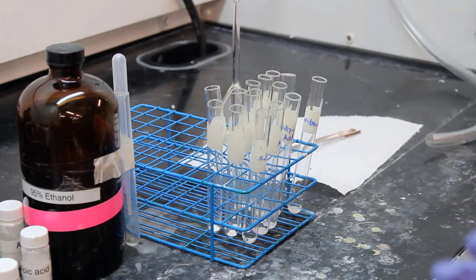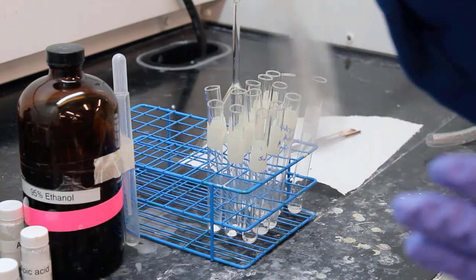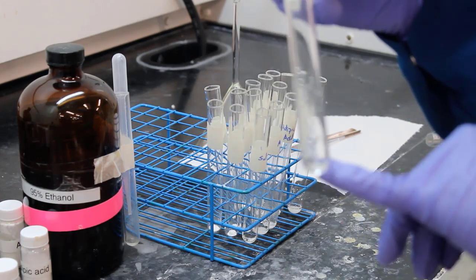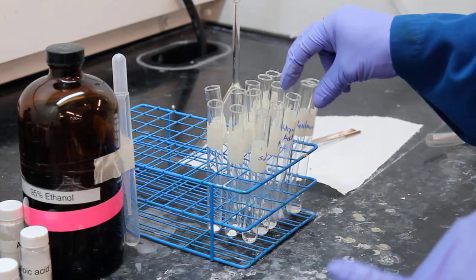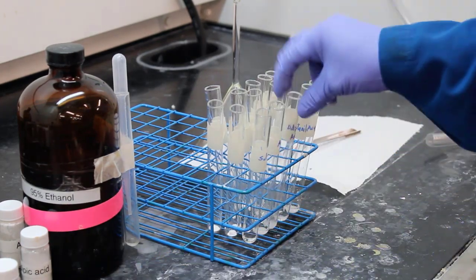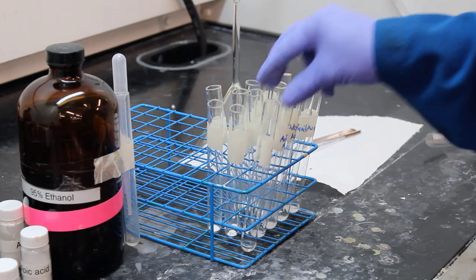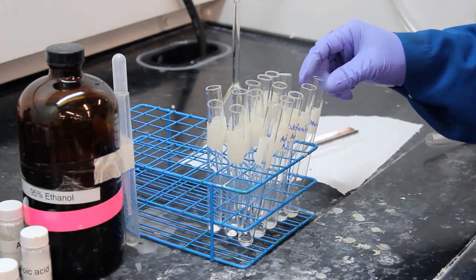All right, they're going to be persistent here. There we go. Let's check on it. Is it dissolving? It is a little blurry, so it's hard to tell, but it kind of looks to me like it's dissolving. And I think that's why they keep shaking it. So if I had to say, acetanilide dissolved in ethanol at room temperature. Interesting.